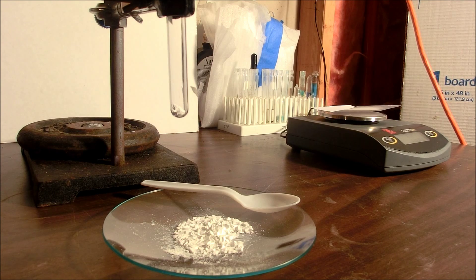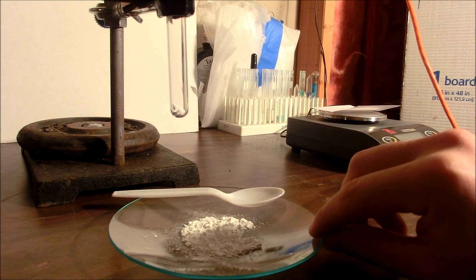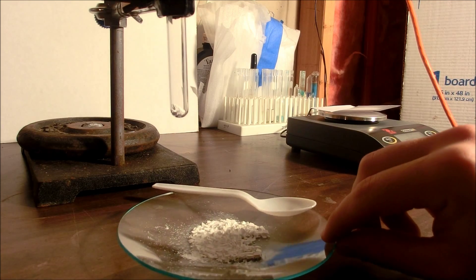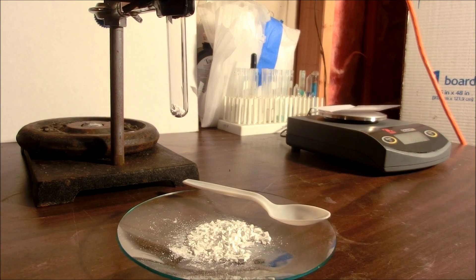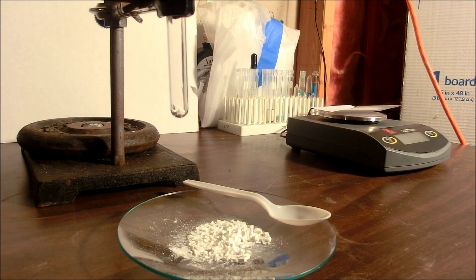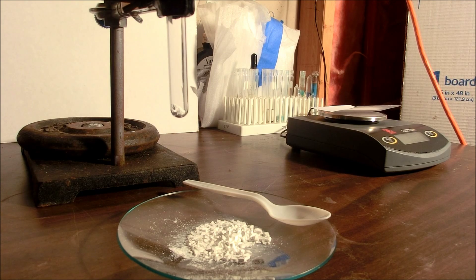So after letting the zinc sulfide dry in the oven for about an hour, I was left with 3.3 grams of amorphous zinc sulfide and this stuff has no luminescent properties whatsoever at this point and I'll just show that to you. As you can see, there's no fluorescence and there's definitely no phosphorescence at this time.